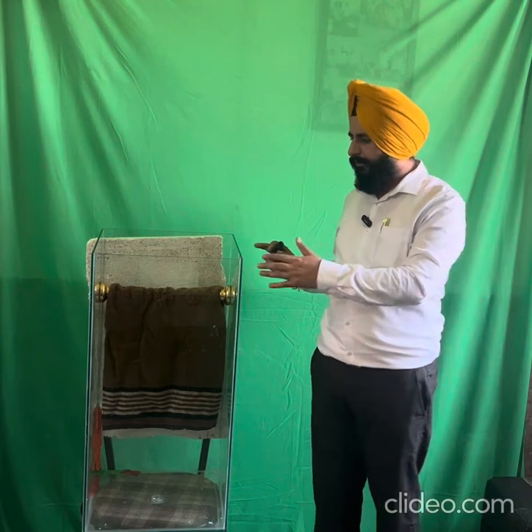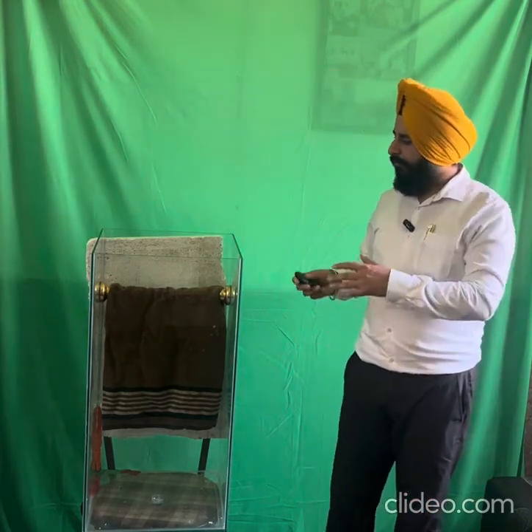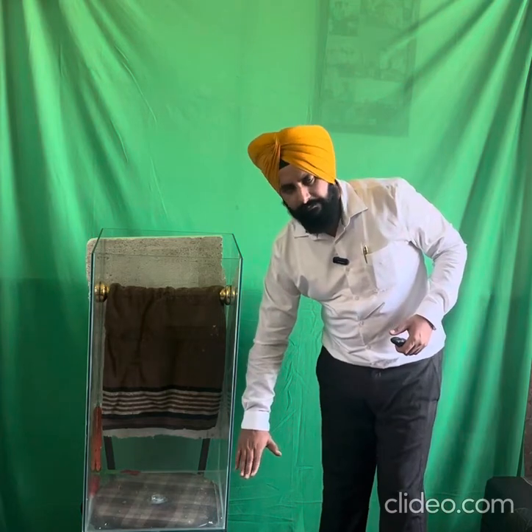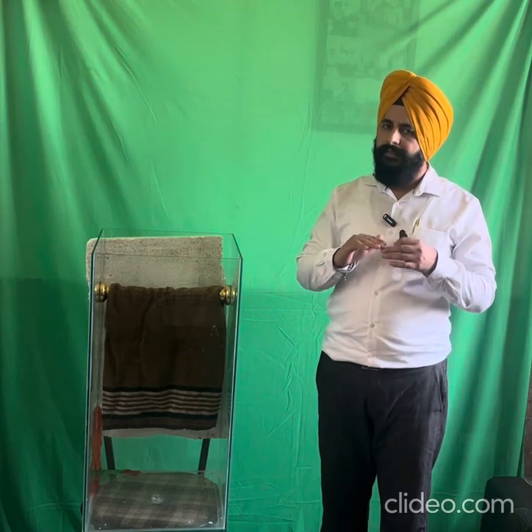The purpose of this instrument is to check grip strength power. The aim of the practical is to check grip strength power in rodents — either mice or rats — using any drug, with the help of the Strength Glass Apparatus. First, fill the apparatus with water up to 17 to 18 centimeters at the lower side. The water temperature should be 25°C ± 2°C.